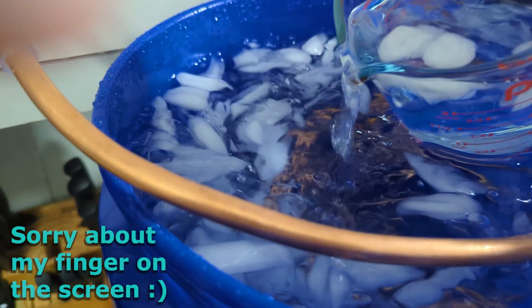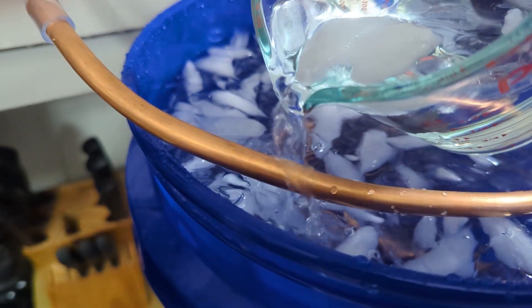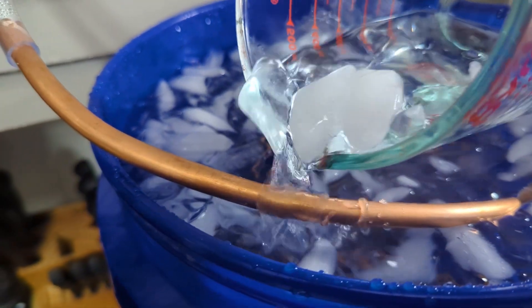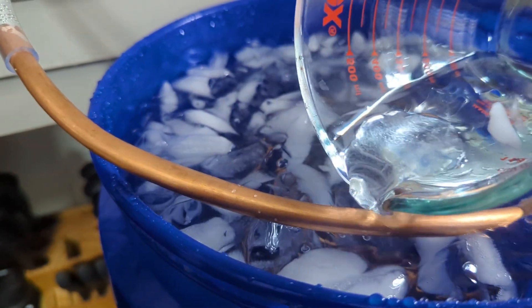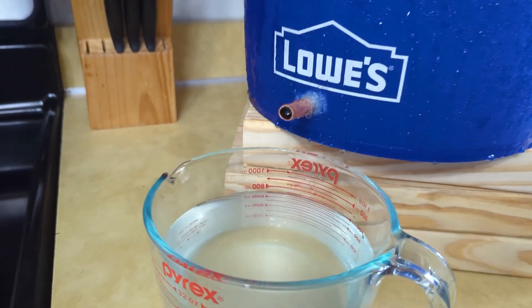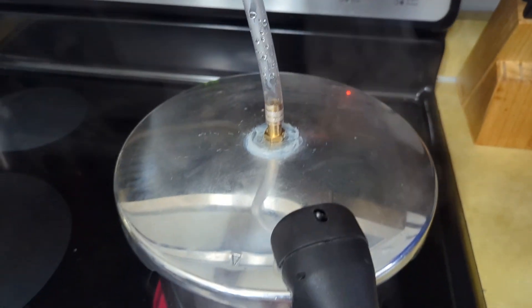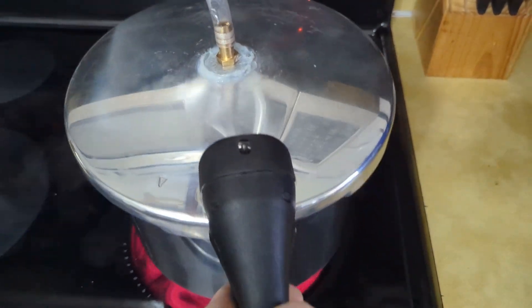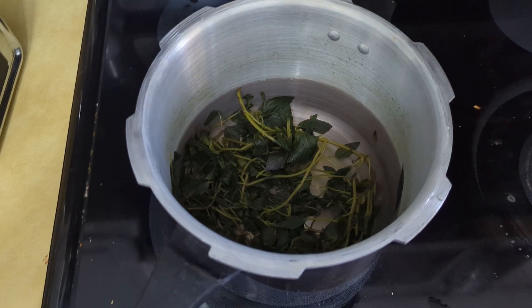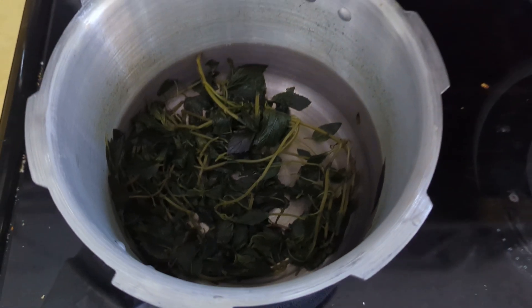I had to cycle out the old water and throw in new ice. I was worried the top of the coil coming out of the bucket wasn't being cooled enough, so I ended up ladling ice cold water on it the entire time. You can see it starting to drip really slowly, meaning it's probably coming to an end — the boiling water isn't as violent, the pot's not as heavy, so it's pretty much done. There's the leftover boiled peppermint: boiled to absolute death, but it did its job. Let's send it a good farewell.